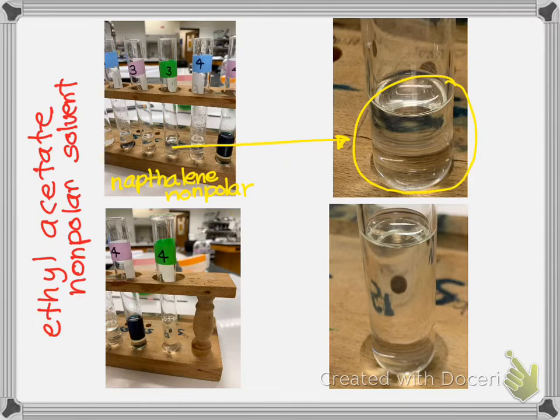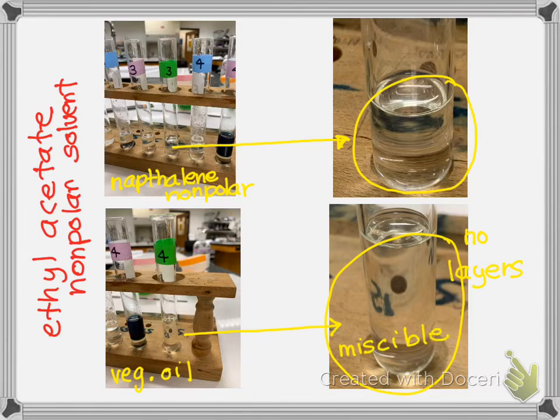And then number 4, this is vegetable oil. And when I look over to the vegetable oil, there are no layers. And so then I ask myself, is this miscible or immiscible? Miscible, which is spelled, you can look at that. Miscible means it would mix, and immiscible means it does not mix. So I'll just tell you, this is miscible. That's how you spell it.